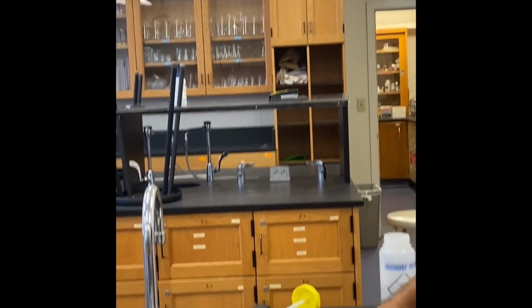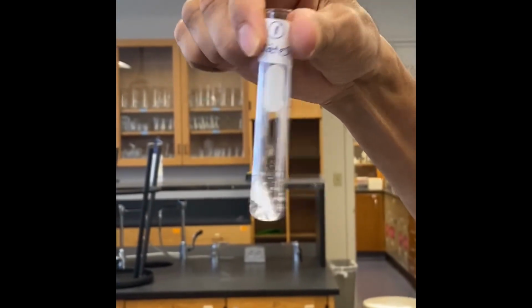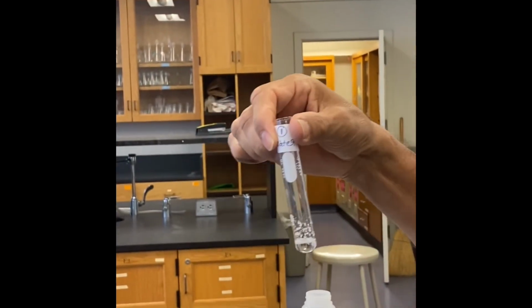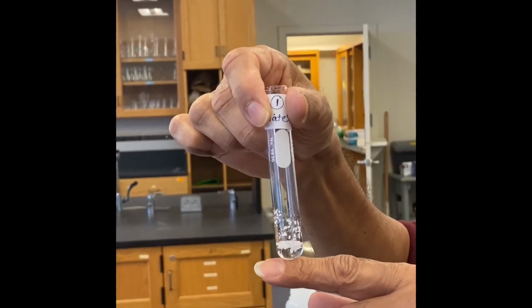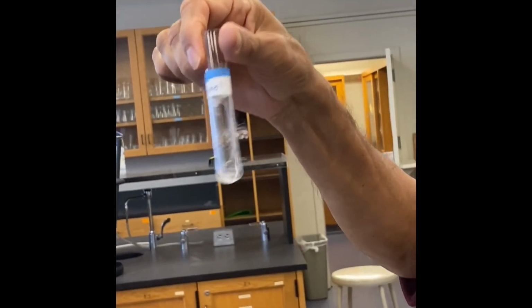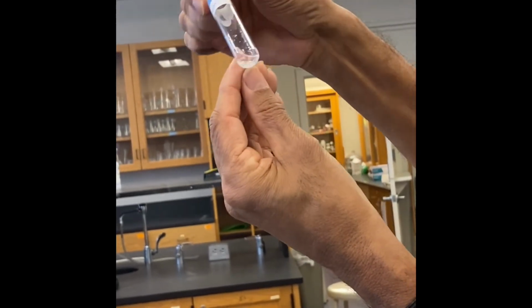Now we come back and check water. You should give 1 minute because the crystals have to dissolve. So as we predicted, biphenyl does not dissolve in water because it is non-polar and water is polar. Methanol is a slightly polar solvent, so it dissolves partially, but you can still see a lot left in methanol.